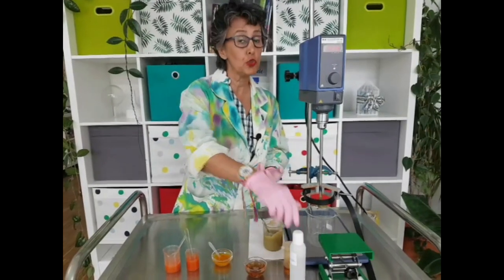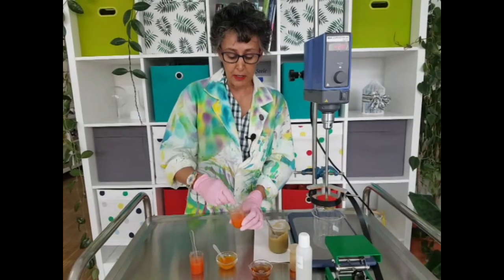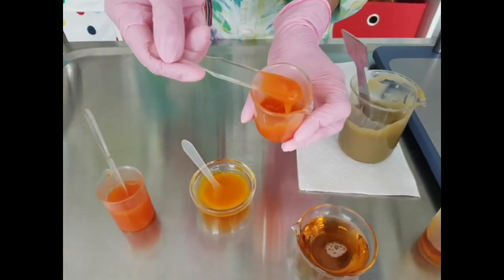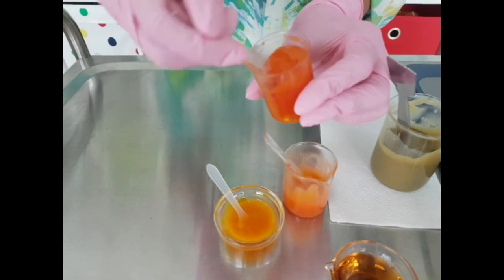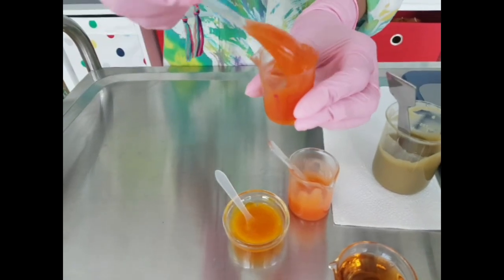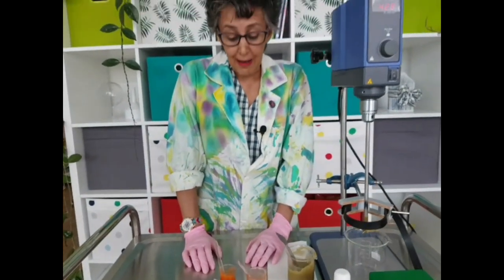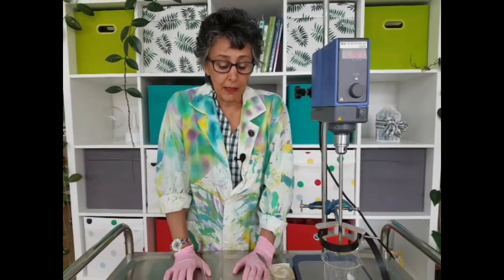So to replicate what you do in your laboratory, we made some samples that we manually stirred. This one was made from beginning to end with only a spatula. And this one was stirred at the beginning — where the viscosity is low — with a magnetic stirrer, and at the last steps with a spatula. It is possible to create beautiful, stable samples, but you need patience, you need time, and you need some muscle power. But basically it will work in an artisanal lab.